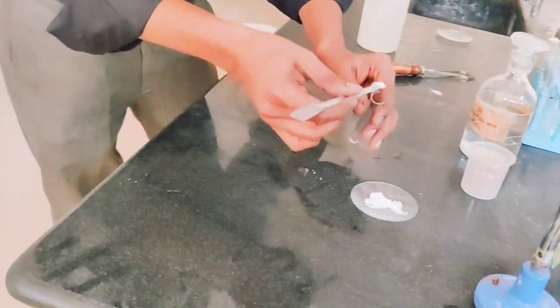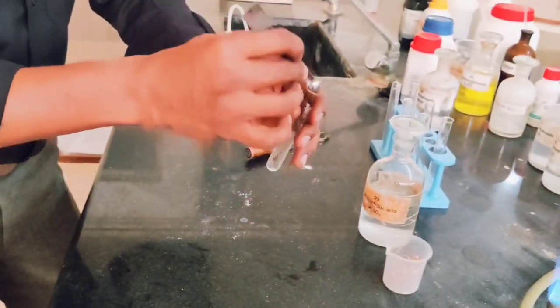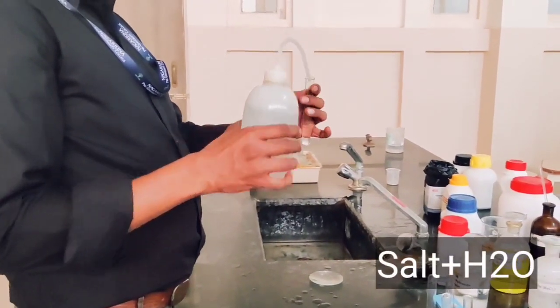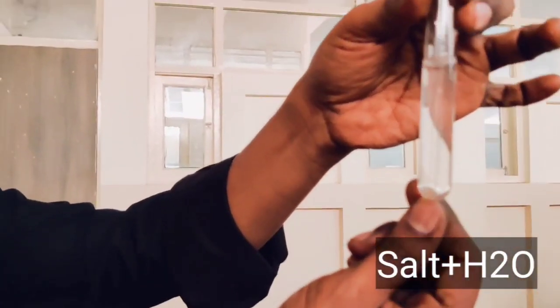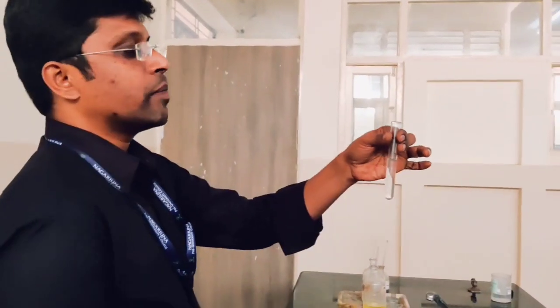After zero group analysis, students, you have to prepare the original solution — this is very important. Always prepare a saturated solution; then only we can get correct results. For the saturated solution, we are already aware of its solubility. The salt has to be mixed with water to prepare the original solution. It should be saturated. There is no turbidity in the solution, so we can proceed with the respective groups.